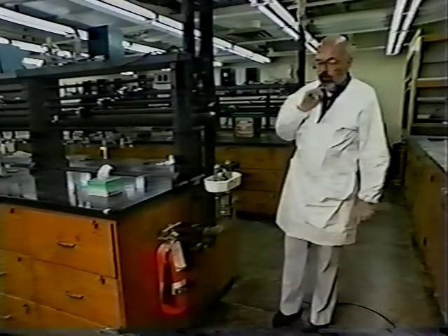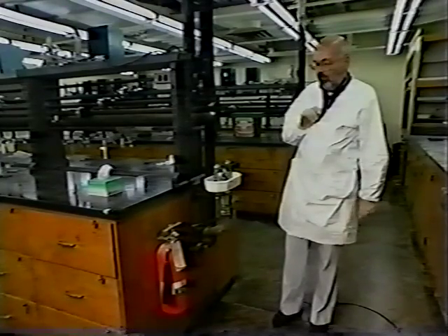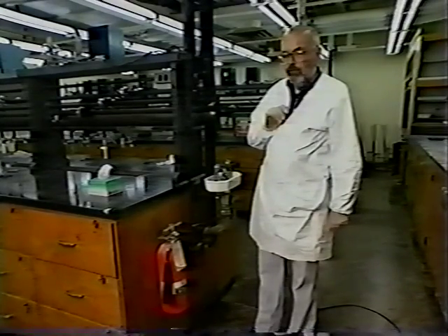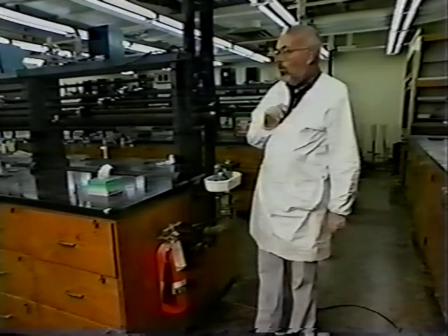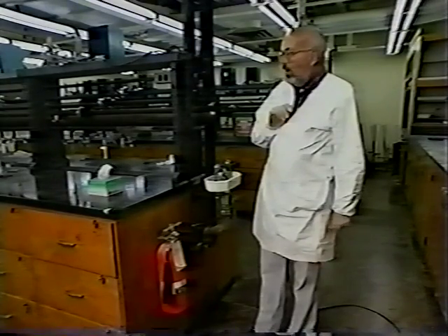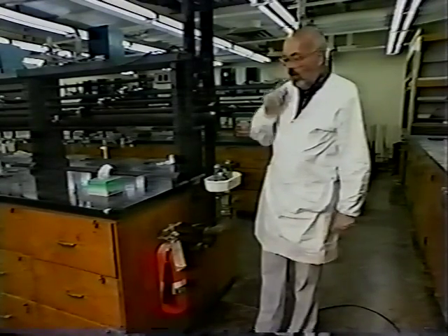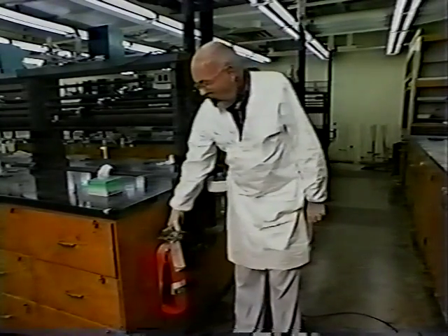Because of our use of the flameless heaters and because of our constant awareness of safety, fires are very unusual in the organic laboratories. However, in the event that a fire should begin, everyone in the immediate vicinity should move away into the hall as rapidly as possible, and the instructor or one or more designated other persons should use the fire extinguishers in the attempt to contain the fire.